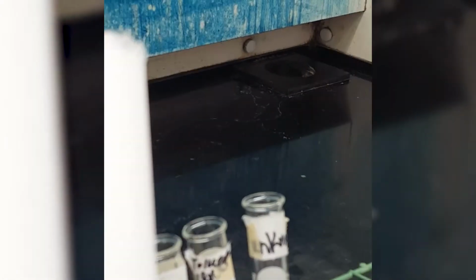Now this is toluene. I added Ligroin to toluene. So, is it soluble? Do you see two layers? Or is it homogeneously mixed? It's toluene homogeneously mixed with the Ligroin. Now lastly, this is the unknown in Ligroin. Is there solubility?